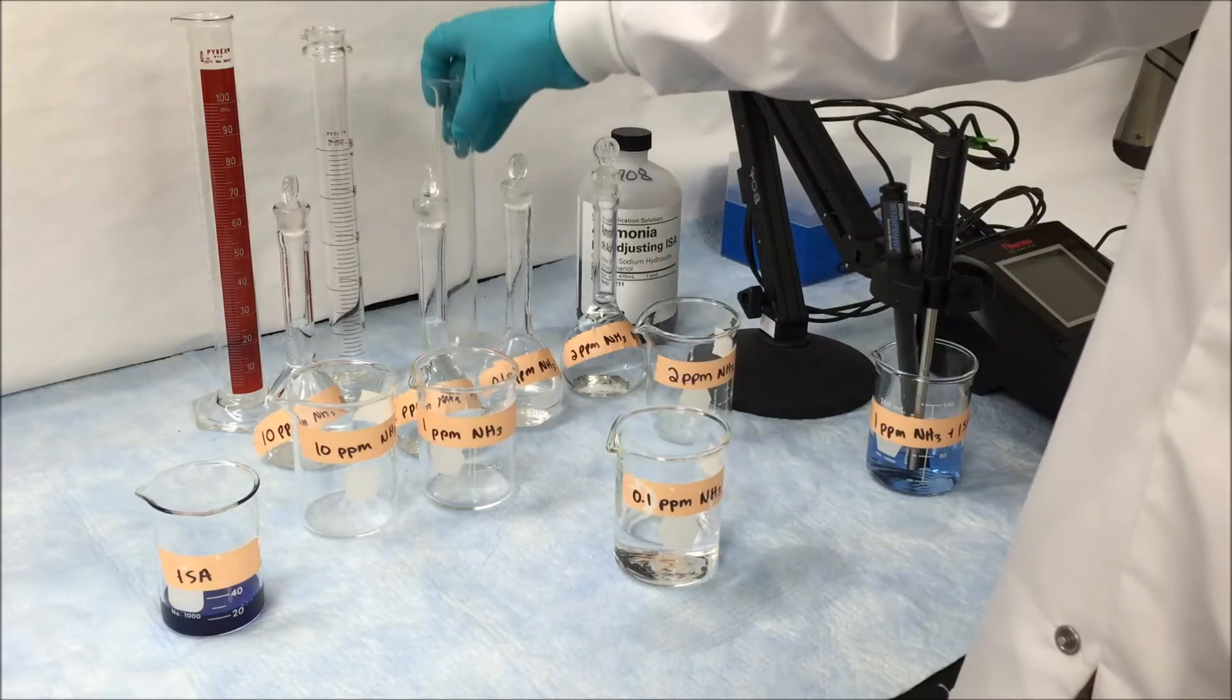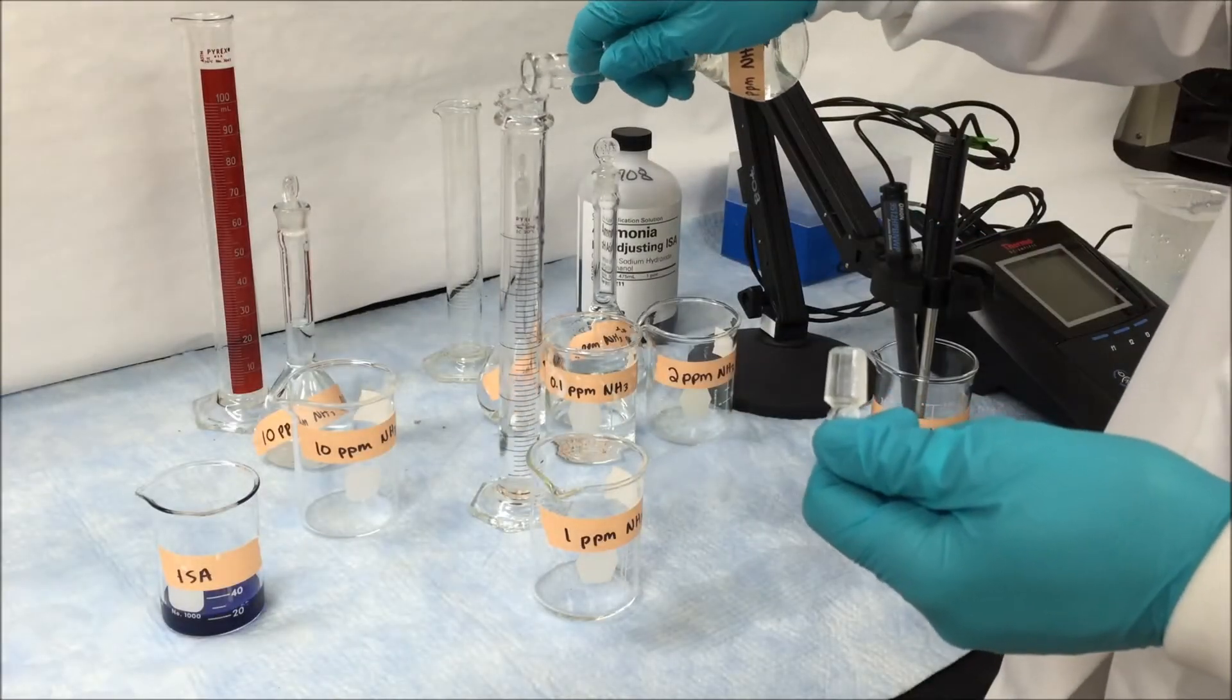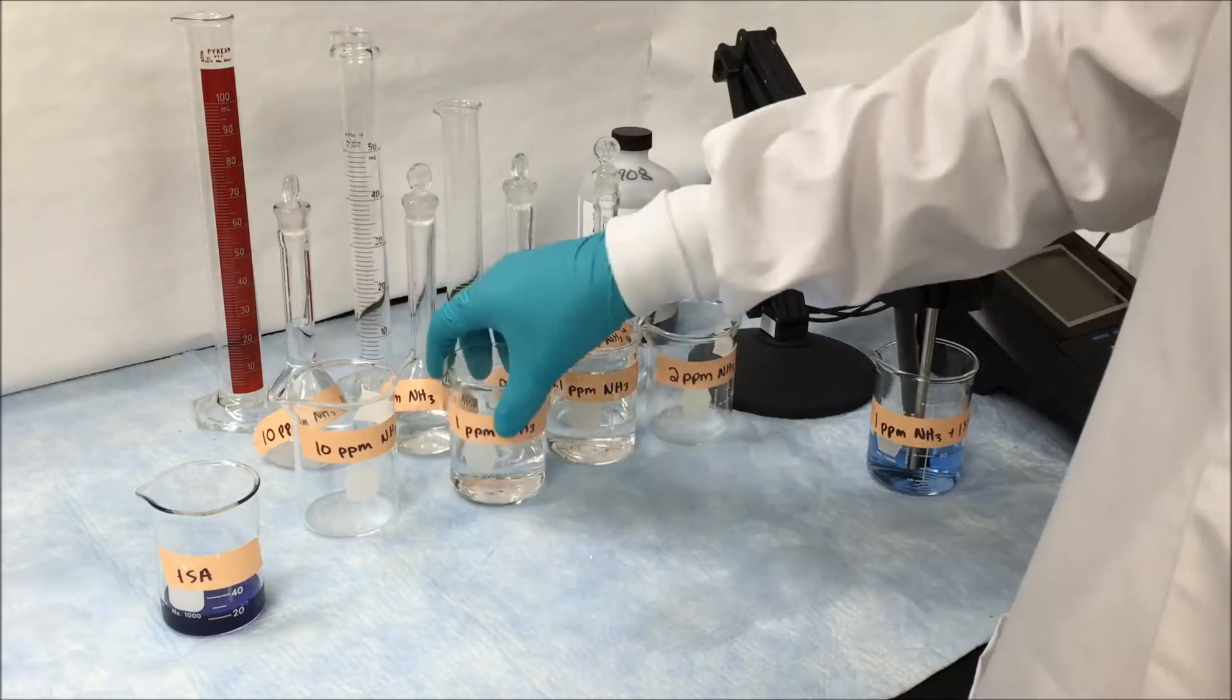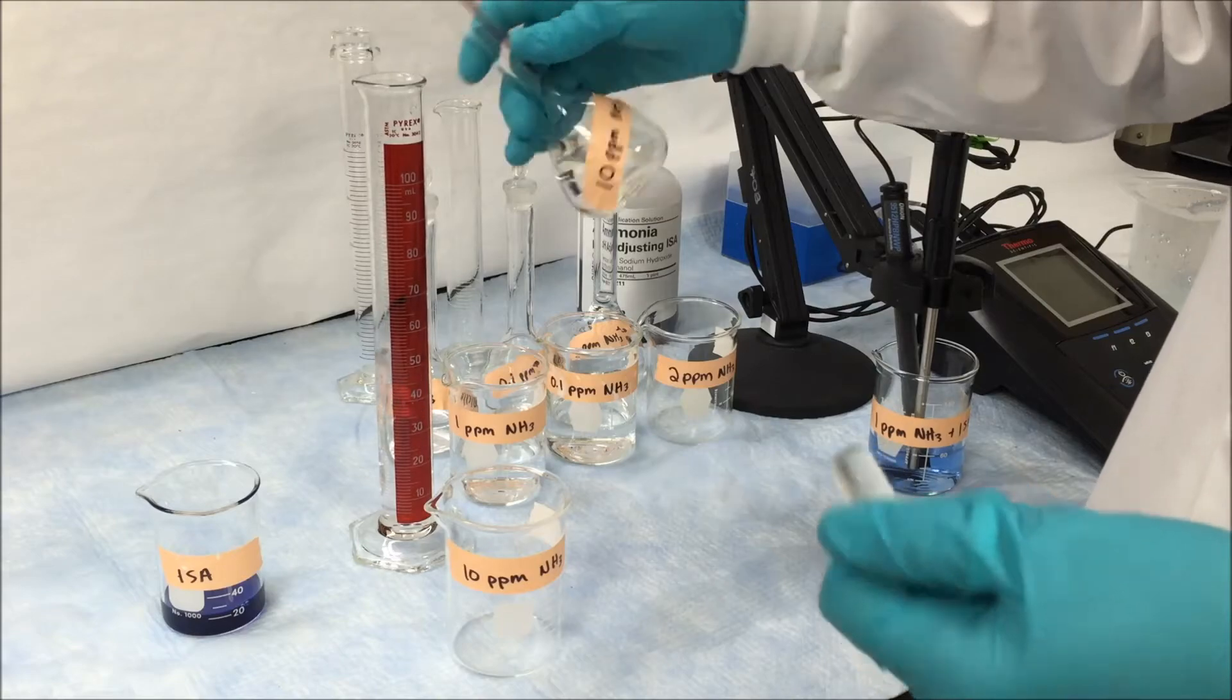Pouring that into a fresh clean beaker, we move on to our next solution. Make sure for every solution you prepare you always use fresh clean glassware to eliminate any sort of contamination. You can use a graduated cylinder or you can use a measured pipette to do this.